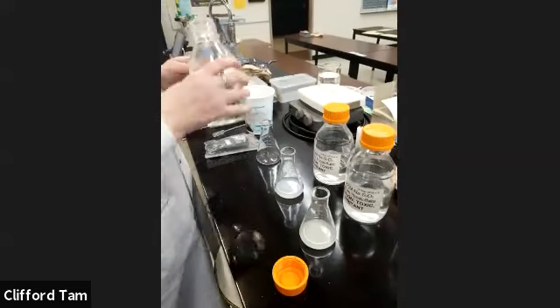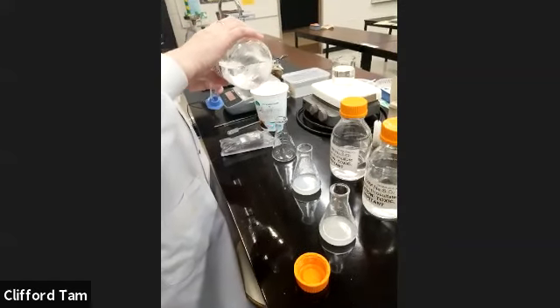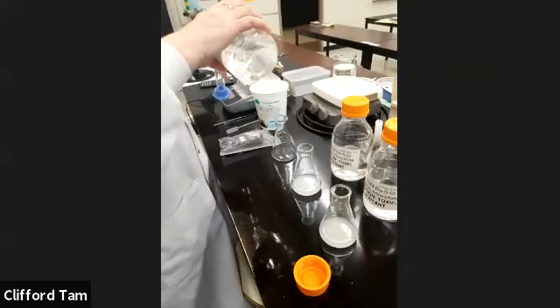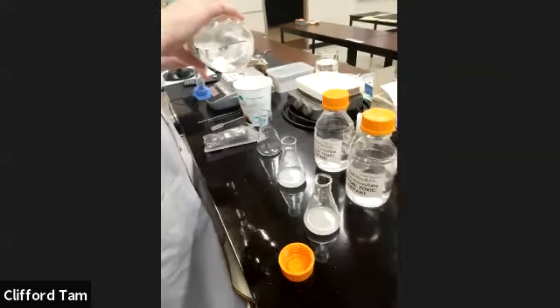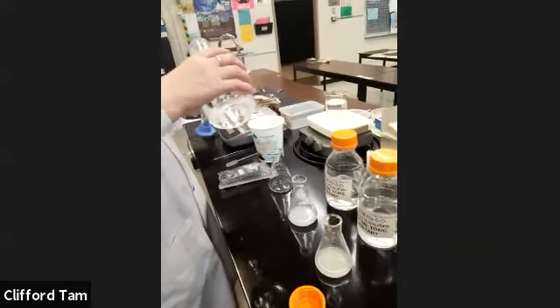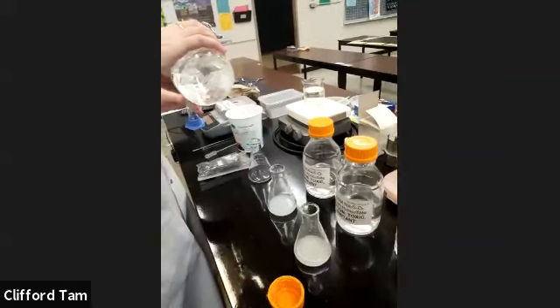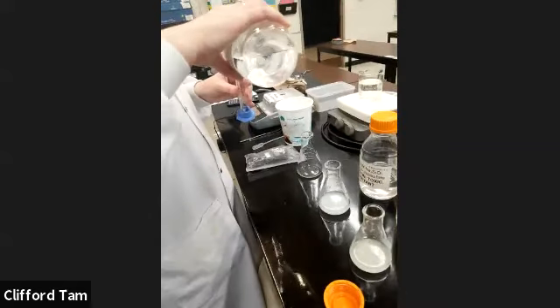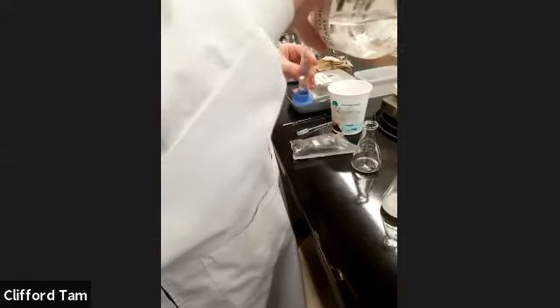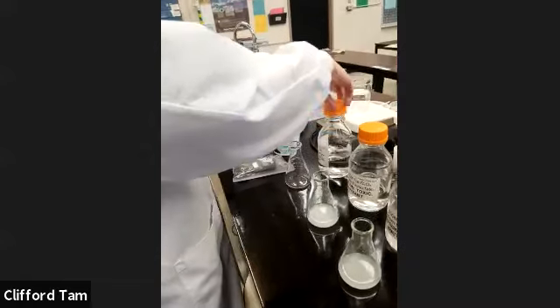Okay. So we're going to do the last one. Xantha was so gracious to have provided this for us, with the last concentration. And that concentration is at 0.0100, I think, moles per liter. Perfect. Okay, so slightly higher concentration.